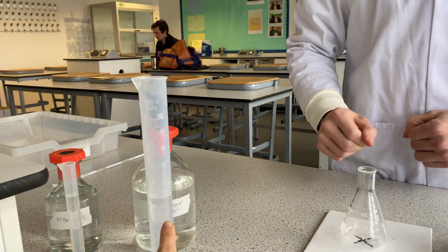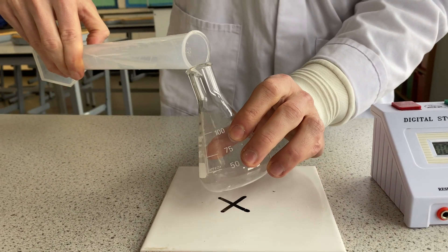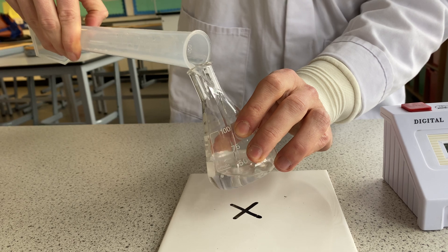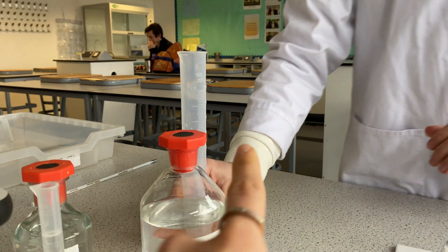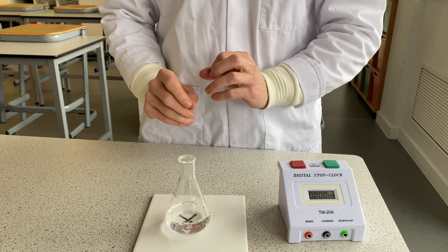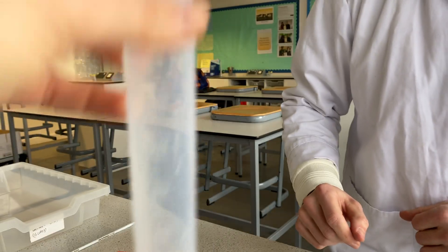50 cm³ sodium thiosulfate and 10 cm³ hydrochloric acid, pre-measured. I'm going to pour the sodium thiosulfate into the conical flask. We don't use the same measuring cylinder for both chemicals to avoid contamination — we want to make sure all of the reaction happens when we mix them together, not before, due to residue from the previous solution.